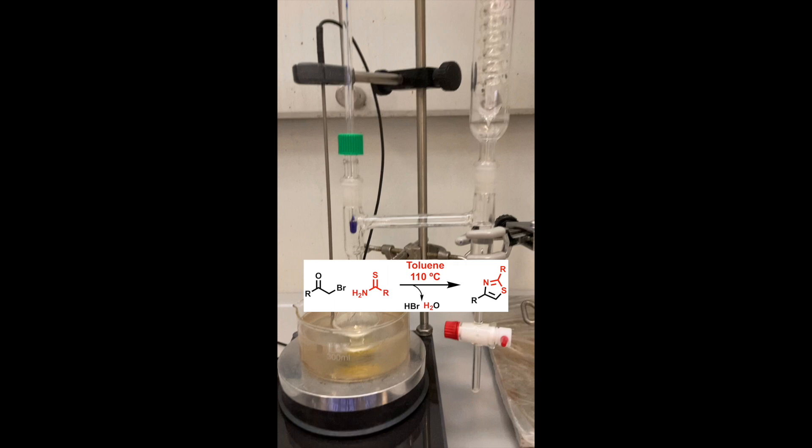Before that, I had tried several different conditions without success. Now, since the condensation between these two molecules involves the formation of water, I thought it would be a good idea to carry out this reaction in a Dean-Stark apparatus, in order to remove the water generated and drive the reaction toward completion.